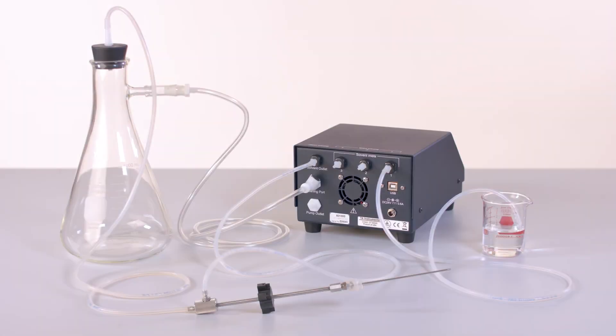The waste line is then connected from the cleaning tool or NanoDSC to the vacuum plug on top of the Erlenmeyer flask. We are now ready to pump water through the instrument.